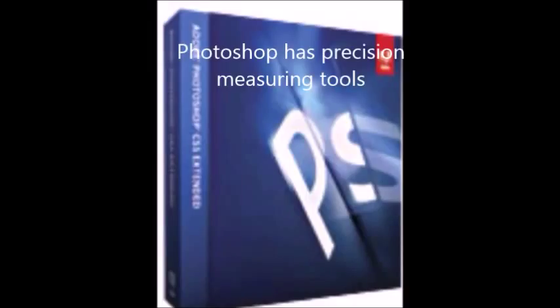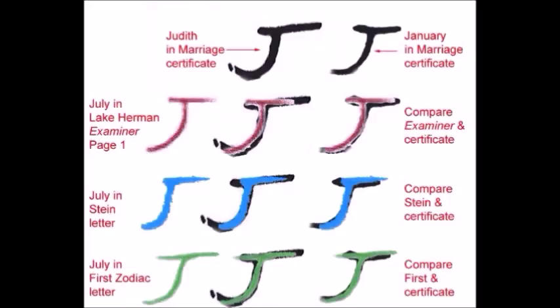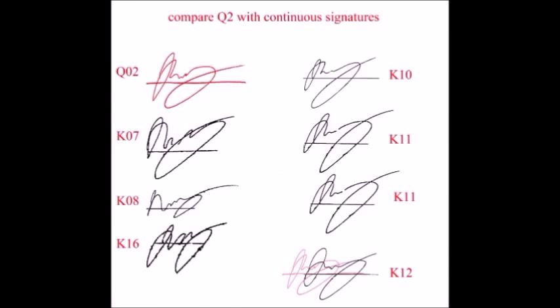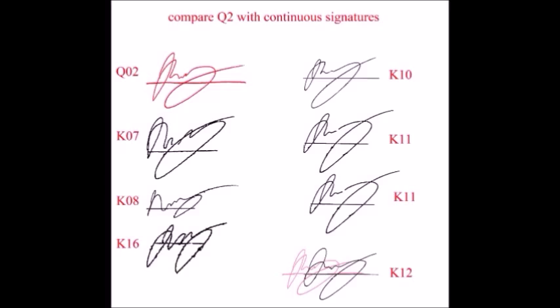Adobe Photoshop is one of the most powerful tools that we use. I'll be showing you some images where I shot the image using a MyScope microscope, which saves it to the computer, then called it up in Adobe Photoshop. In Photoshop you can enlarge the image, change the color, and take one signature and overlay it on top of another to see how similar they are. It's very powerful software.